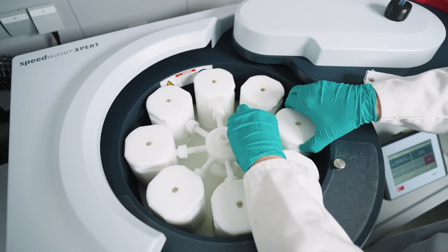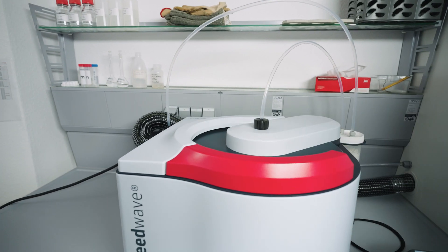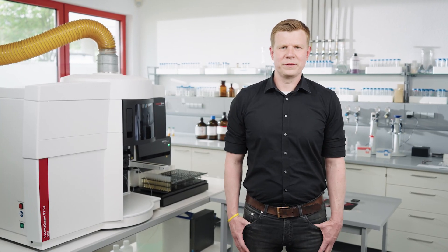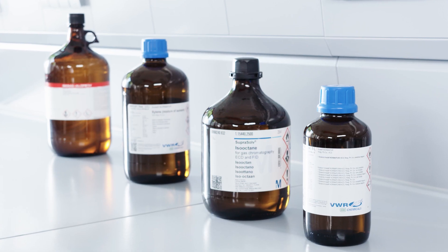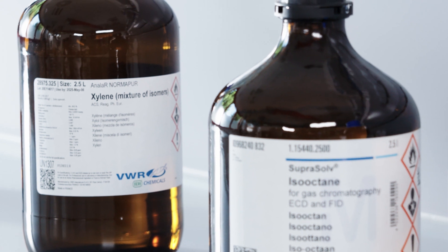One possibility for sample preparation is mineralization via ashing or microwave digestion. In addition to some advantages, this preparation technique has also some disadvantages, like the high dilution factors and therefore losses in measurement sensitivity. A widely used alternative is the direct dilution in an organic solvent, which eliminates the digestion step. Furthermore, it simplifies the sample handling in the preparation step and allows for significantly lower dilution factors, leading to an improved detection sensitivity of trace elements. The choice of solvent depends very much on the sample type, and orientation is provided by the corresponding industry standards.